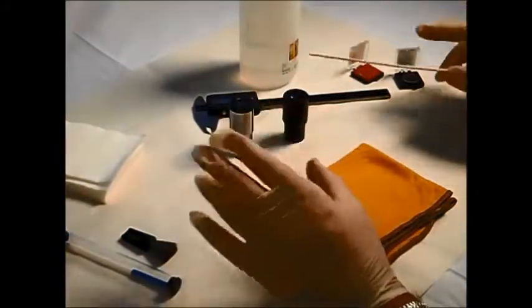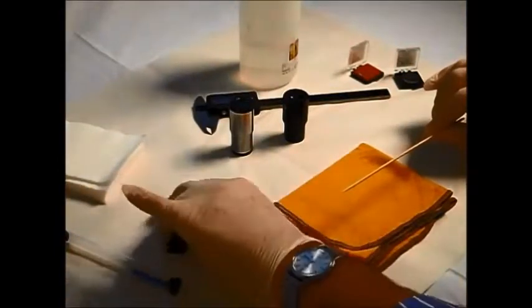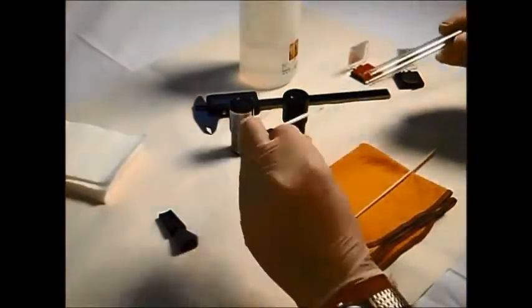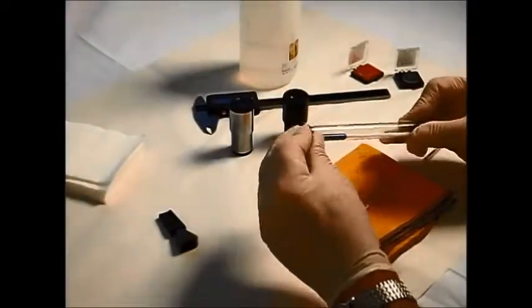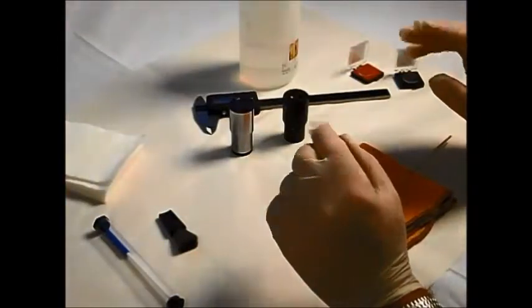Optical cleaning kits are readily available which have all of these in it, and they may come along with some additional items and tools such as brushes or anti-static cloths like this one, or speck grabbers, which allow you to take individual specks of dirt or dust from particular glass. But in my opinion, the most important tool in the whole kit is a pair of rubber gloves, these lab gloves. Make sure you don't get any finger marks on the assembly. They keep finger marks at bay.